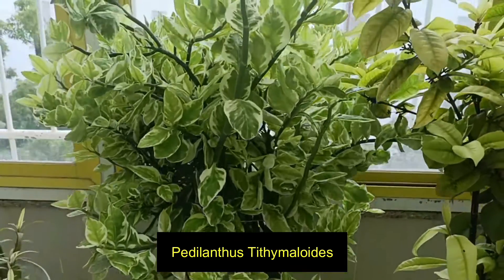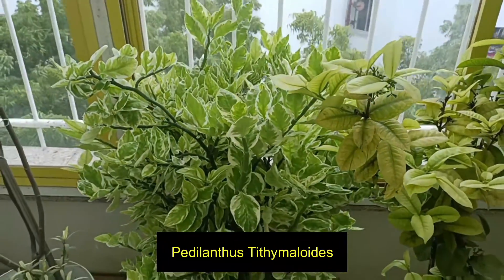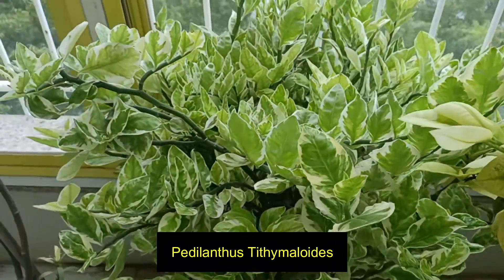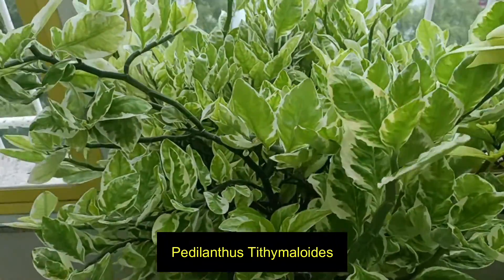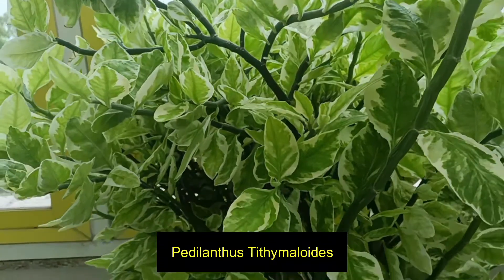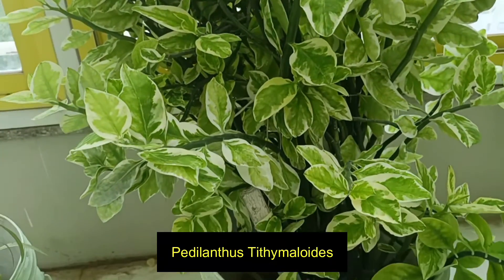I hope you will enjoy this experiment — let's do the experiment! Here I have taken a Pedilanthus plant. As you can see very well, the Pedilanthus leaves are variegated — they don't have chlorophyll everywhere on the leaf.